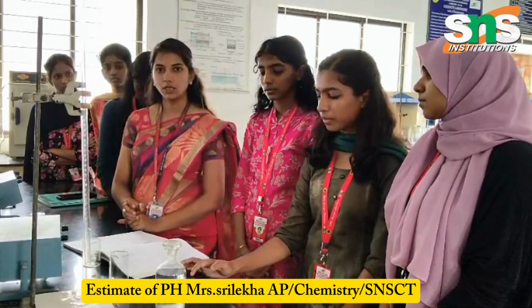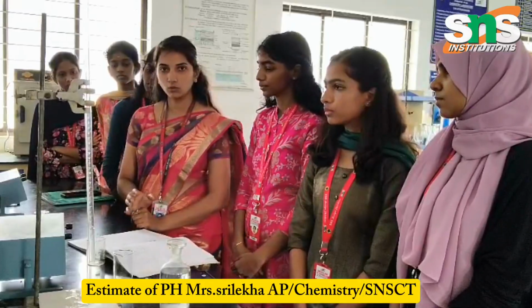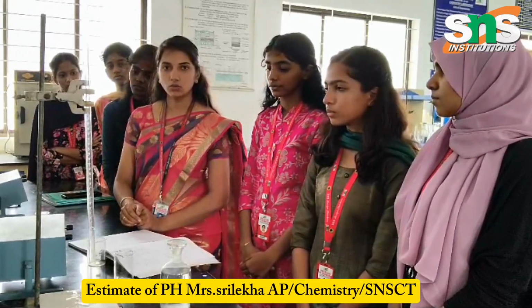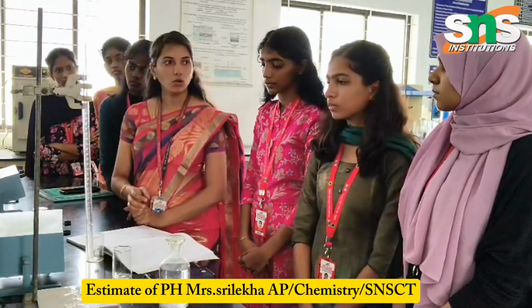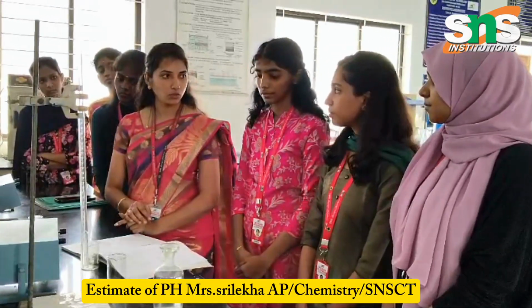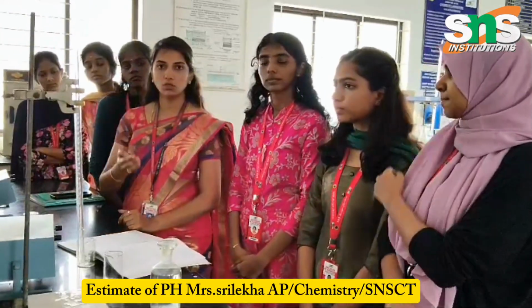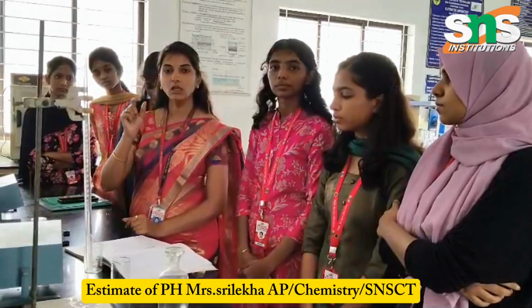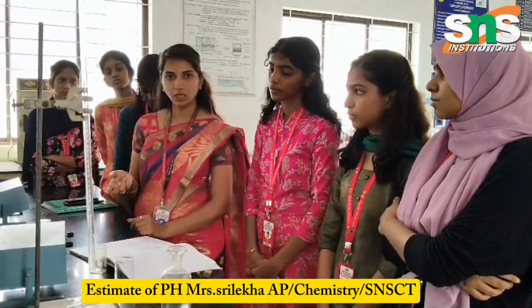So I am taking the HCl solution, and the particular H plus ion concentration is what we measure. I am going to consider the burette solution and pipette solution for the titration in this experiment. What is the burette solution we are using? Sodium hydroxide. And the pipette solution is hydrochloric acid, HCl. We take the NaOH from the burette into the HCl, and H plus is removed from the HCl, so we consider the pH values.